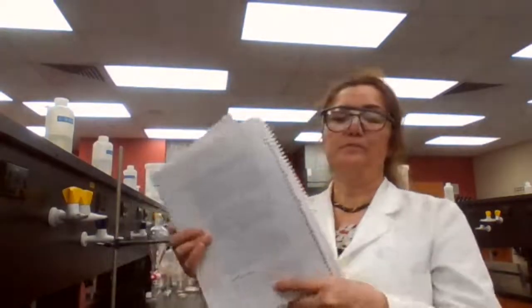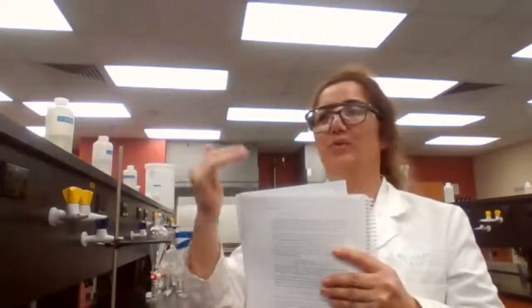But the actual term that is used for extraction in the book is the KD value, and that is the distribution coefficient. Distribution coefficient basically says how soluble one compound is in the organic layer versus in the inorganic layer, or how soluble your compound is in the extracting solvent compared to the other phase.